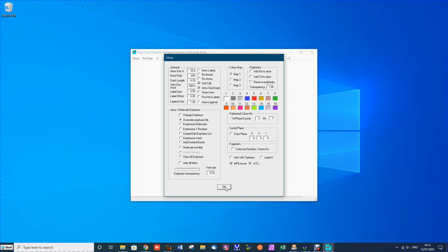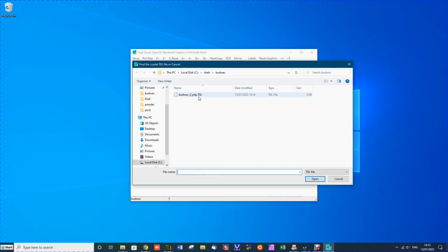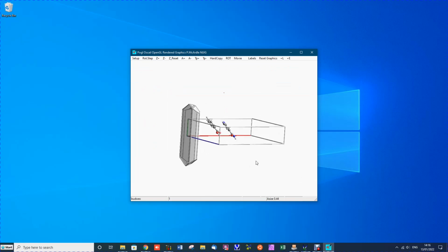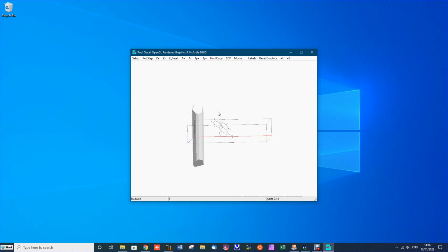When we do that, we are asked to pick the shape we want to use, and it's the one we just generated. And now we can see that the extended growth direction is the B-axis. You can see that the red A-axis is along there, and the blue C-axis is there. The B-axis is the short one. So the extended growth is along the short axis.